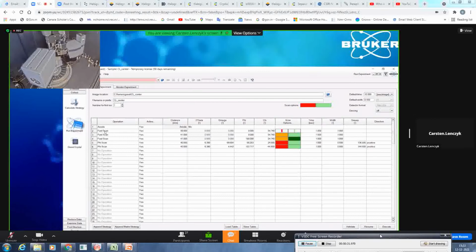And to ensure that you really get all reflections, you have different setups here. So you have this with the detector modes. So the sensitive is our photon counting mode. This is very, very excellent to be used for weak data. I always try to collect your data if possible in this mode, because it is more accurate. So the data you will collect is more accurate than the dynamic mode, which is the charge integrating mode. The charge integrating mode has the advantage that it has a wider dynamic range. So if reflections are topped in your sensitive mode, you would be very good to recollect the data in the dynamic mode.